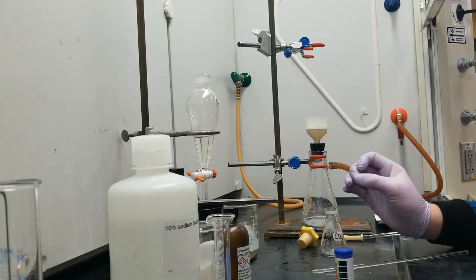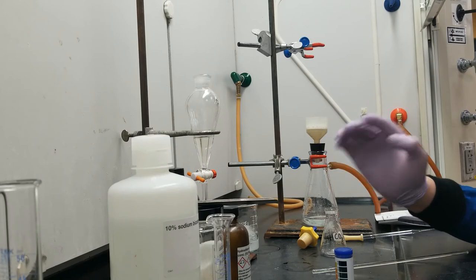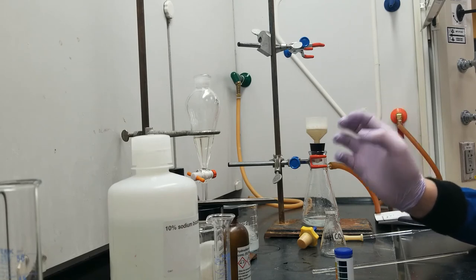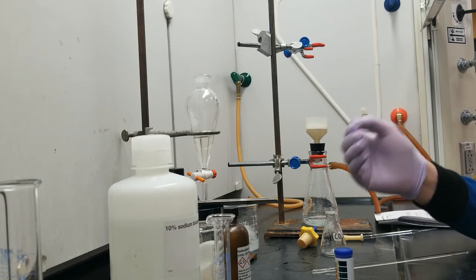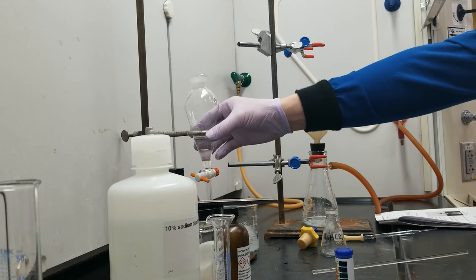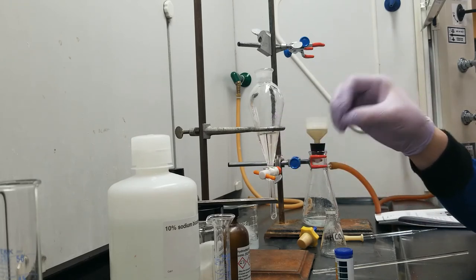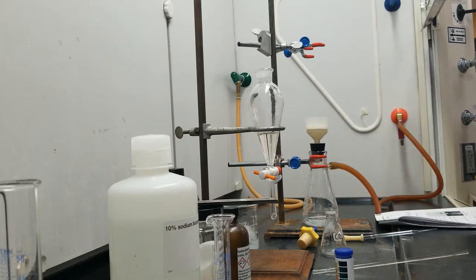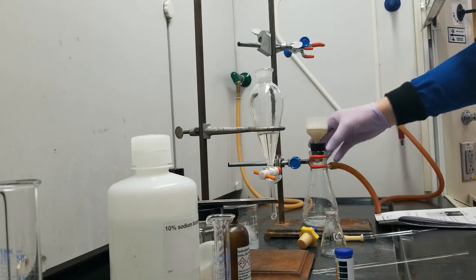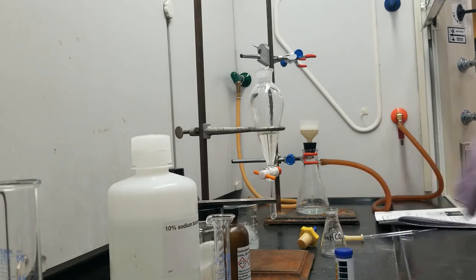Now I know for a fact that this 3-chlorobenzoic acid is actually really good at hydrogen bonding. Even if it's not soluble in water at this point, it has a pretty strong attraction to water, and so it takes forever to dry. You get to skip that. But actually, while this is drying, I'm going to go ahead and prep my diethyl ether layer here so that I can rotavap it and collect the acetanilide in this layer. Yeah, let's turn off the vacuum for now so you guys can hear me. I'll continue drying this at a further stage.